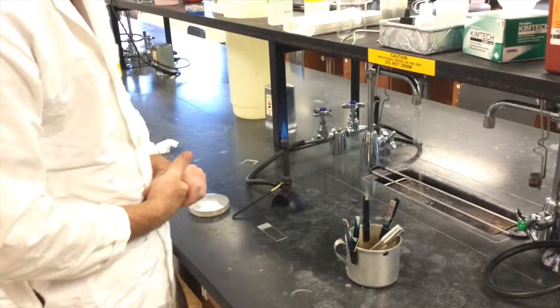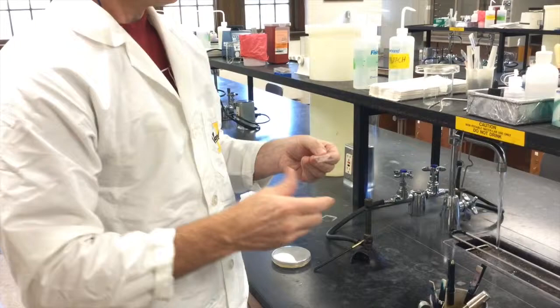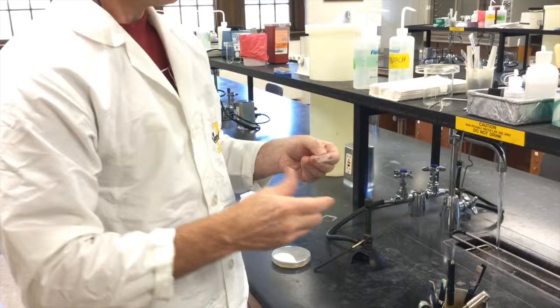You can place your loop down onto the metal tray by the Bunsen burner, get it out of your way. Now you have your samples applied to the slide. We now have to fix or affix the cells to the slide so they don't wash off during the staining process. Before you can do that, you must allow your liquid to evaporate. So air dry.